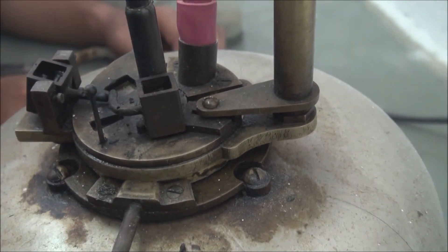We can conclude that for a lubricant, the flash and fire point should be higher so as to prevent any damage to the machine.